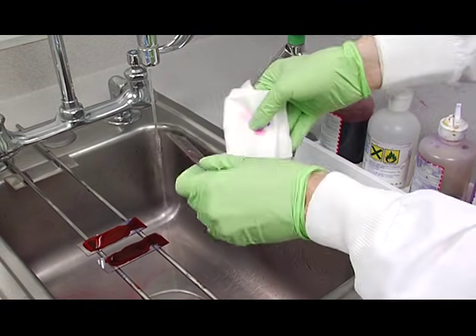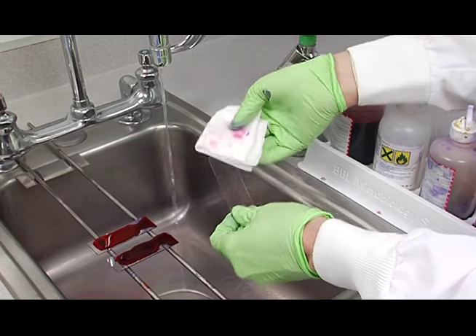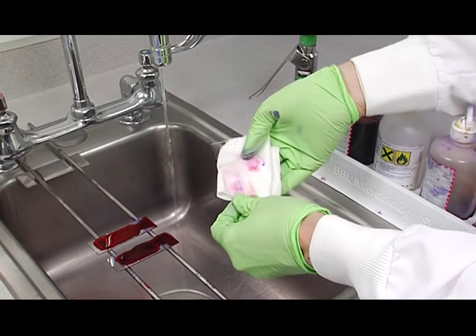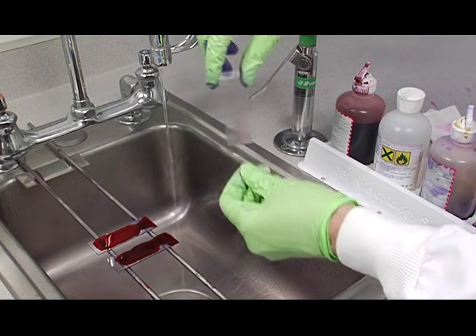Then you can wipe the back of the slide on a paper towel. Make sure it's the back and not the front, and place it in your rack to dry.